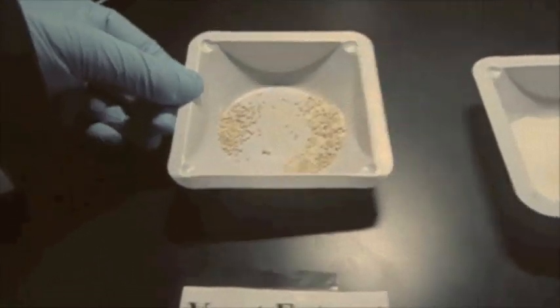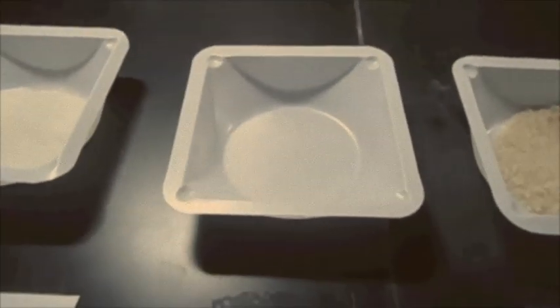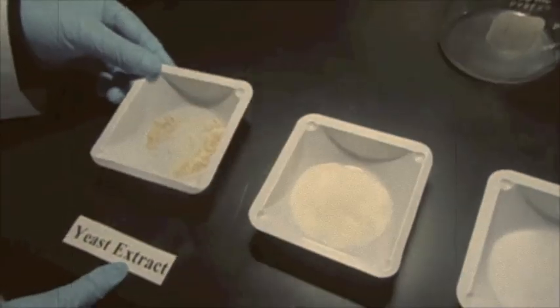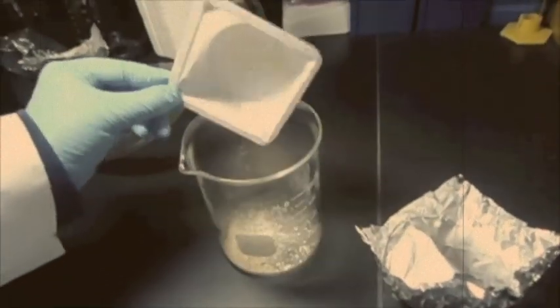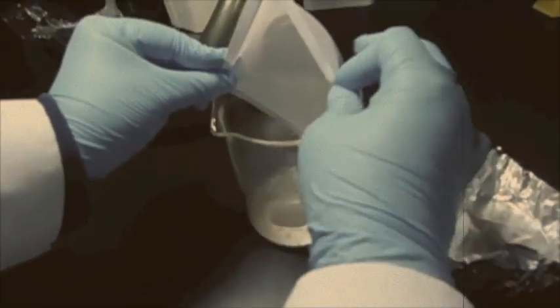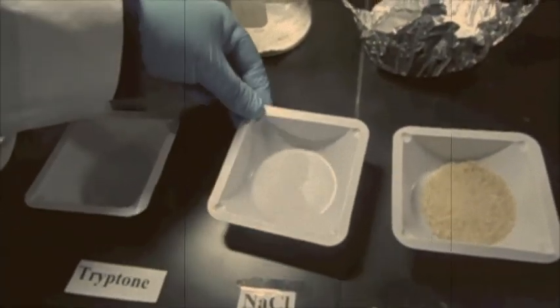Next, you will need to mix the following ingredients. These ingredients are yeast extract, tryptone, sodium chloride, granulated agar, and DI water.